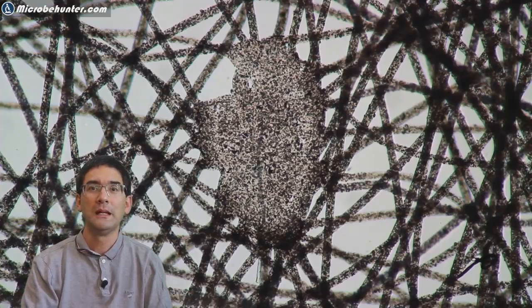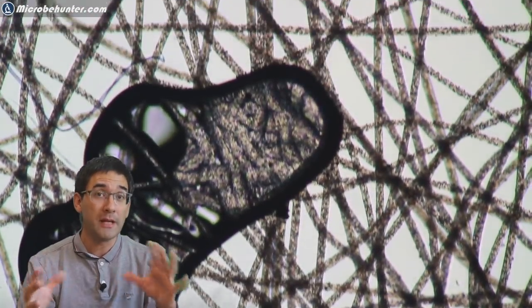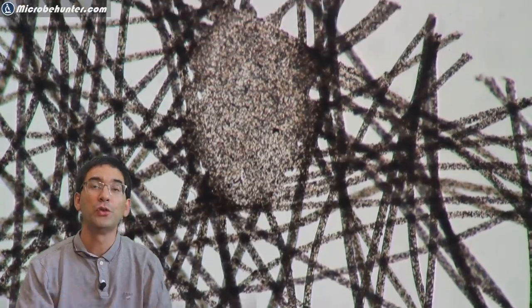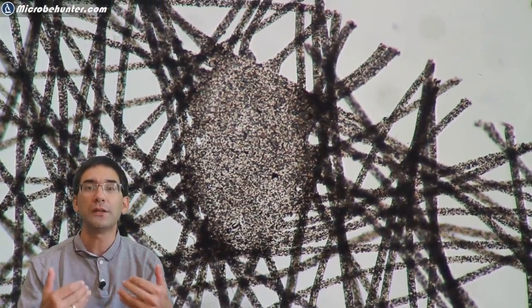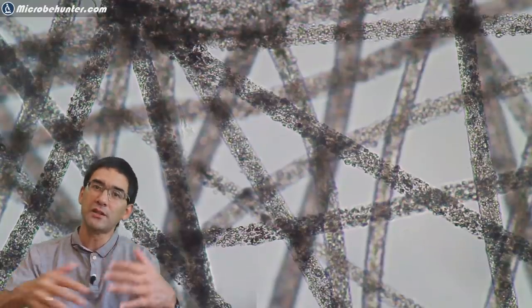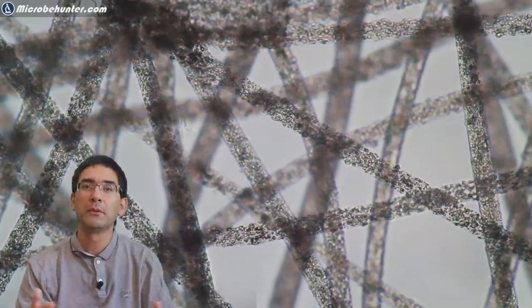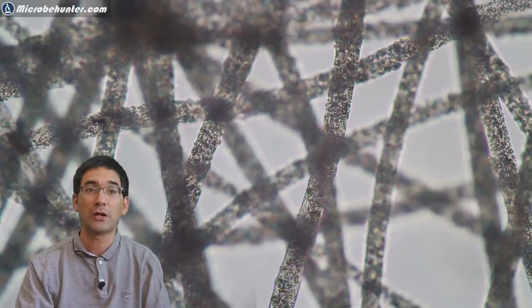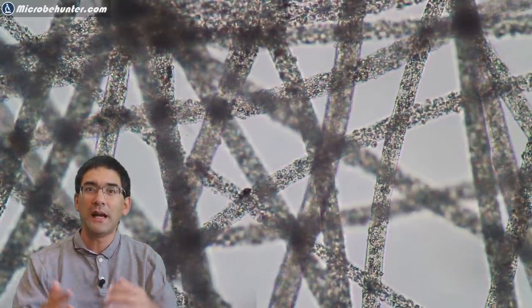I rotated the cover glass a little bit into the right direction and then put it under the microscope again. I was able to see again at low magnification those patches and some occasional air bubbles which I did not easily remove. You might also notice now that the fibers look a little bit brighter. The reason is because the refractive index between the fibers and the surrounding mounting media is more similar, and this allows more light to actually go through.